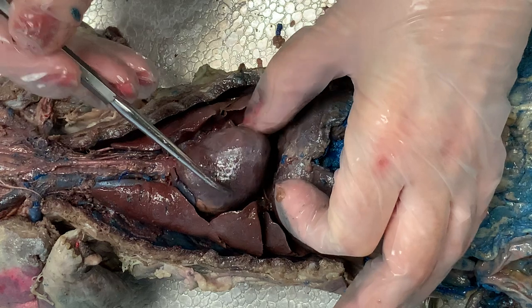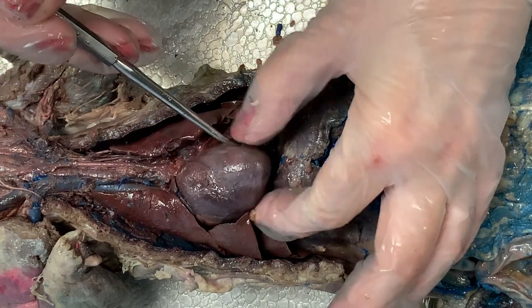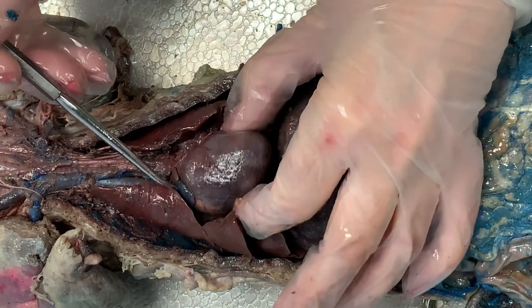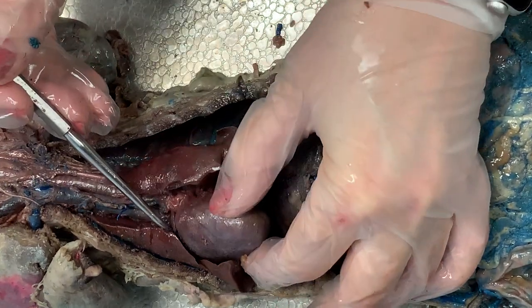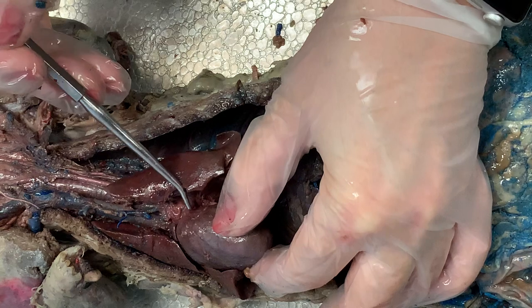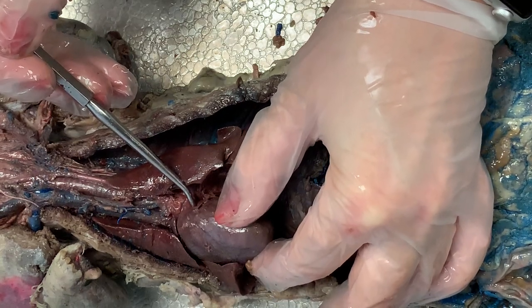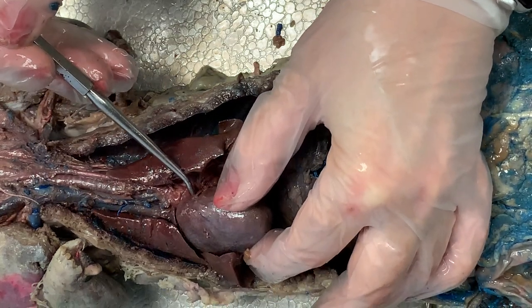So I've got the right ventricle, left ventricle, right auricle — and if I roll the heart over, the left auricle right here.